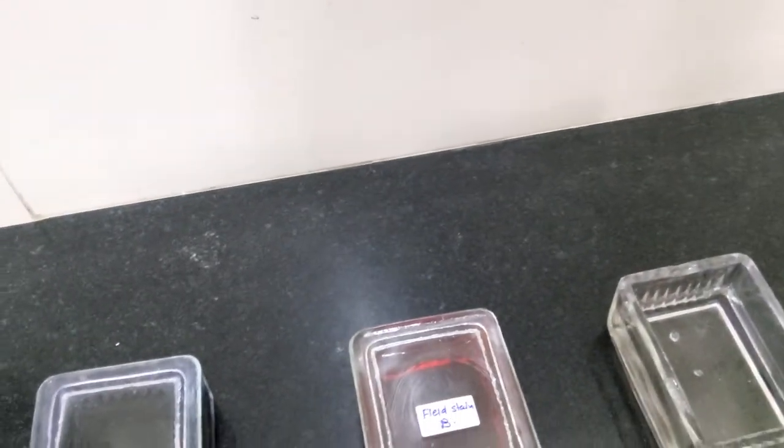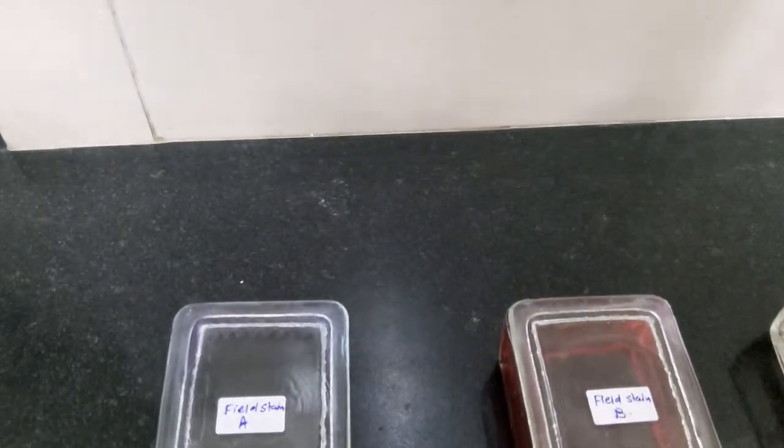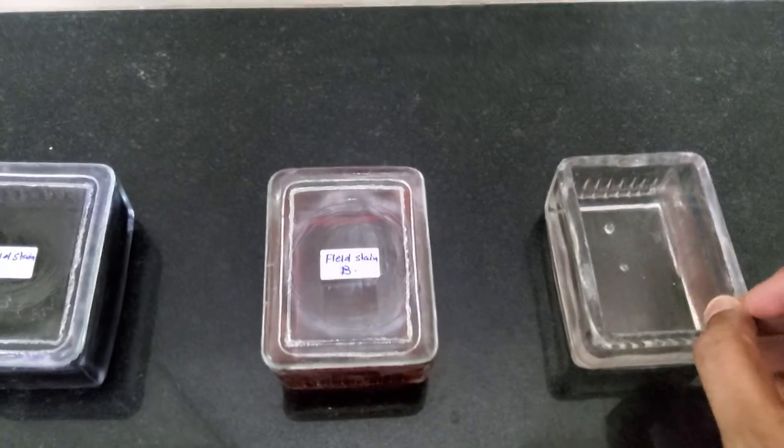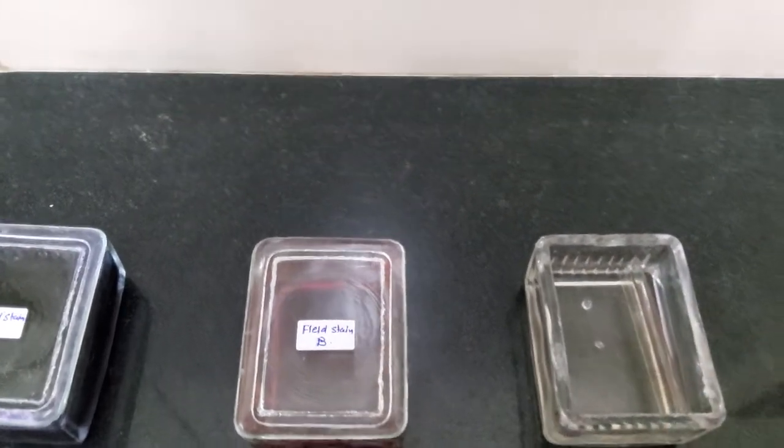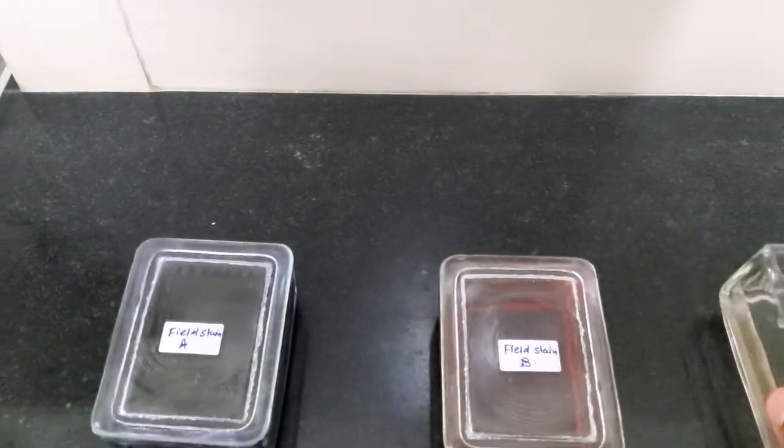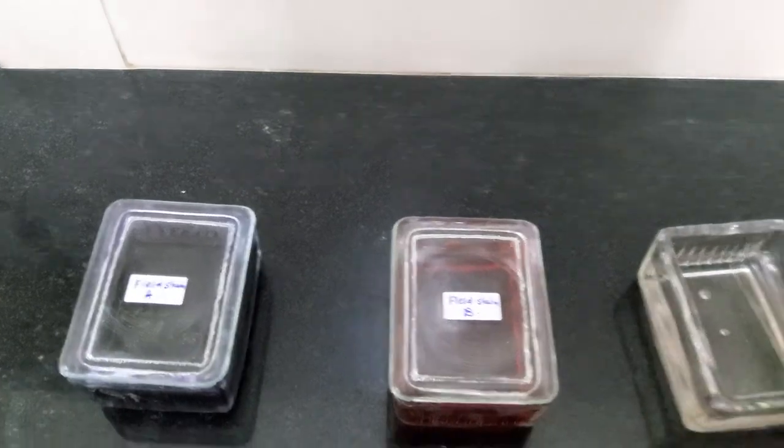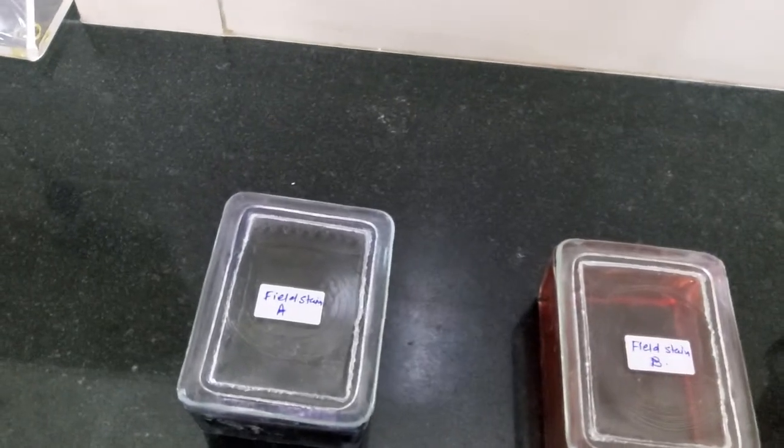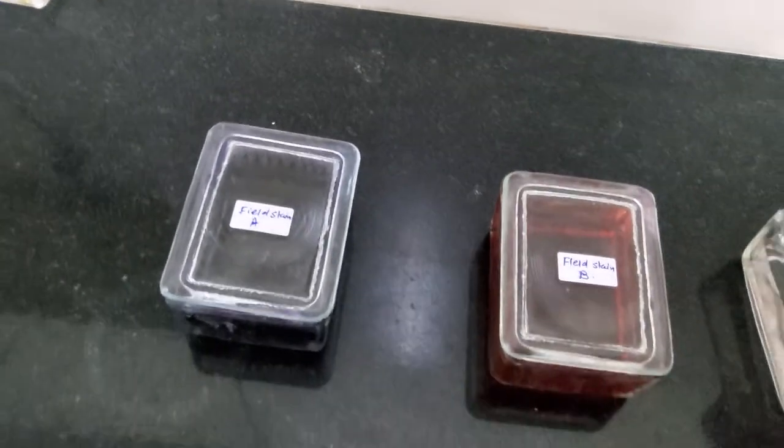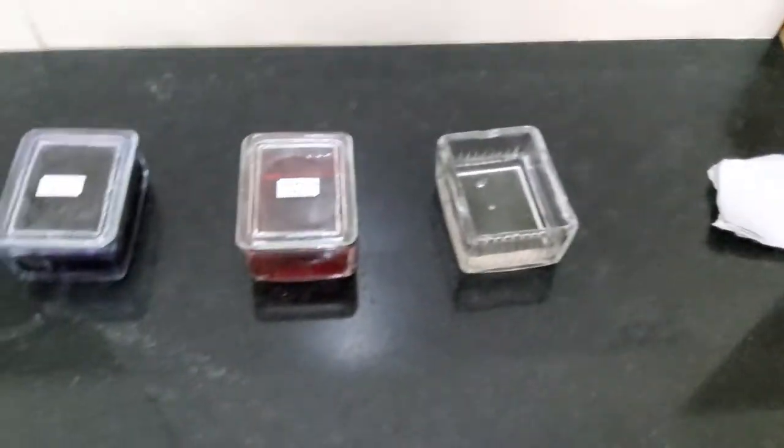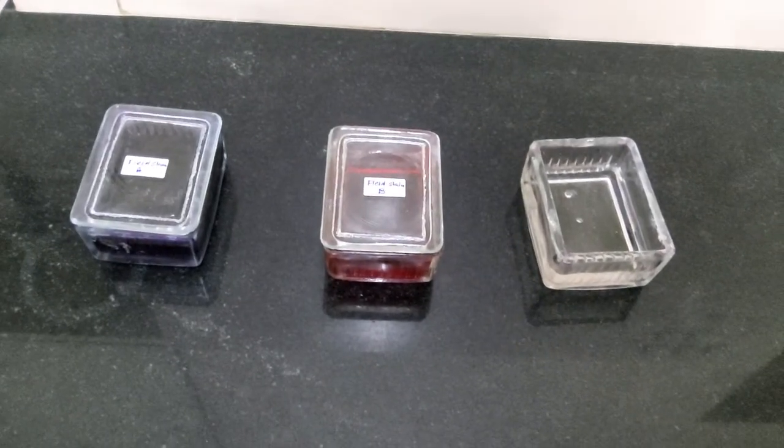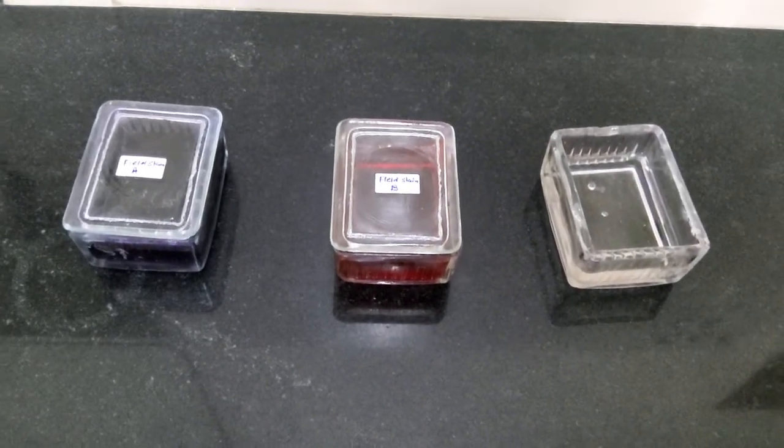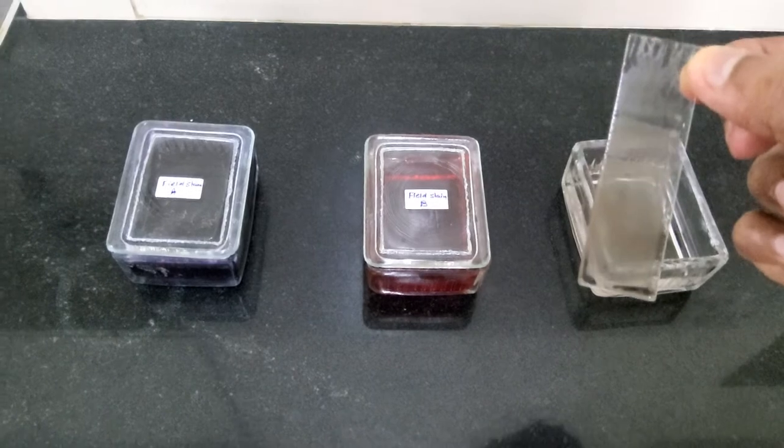I am going to quickly put my slide into methanol. Just normally ensure that the level of methanol is reaching or covering the entire slide. You have to quickly remove your slide from it. Don't let it be there for a very long period of time.